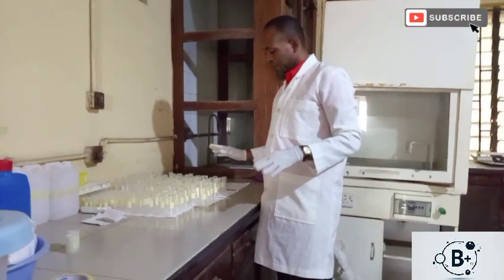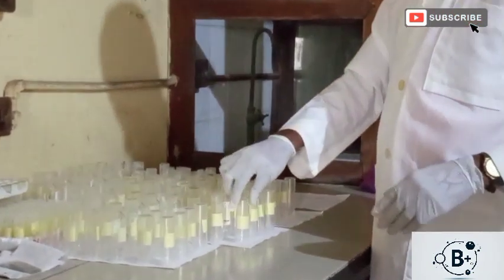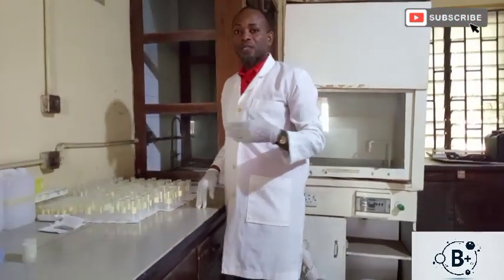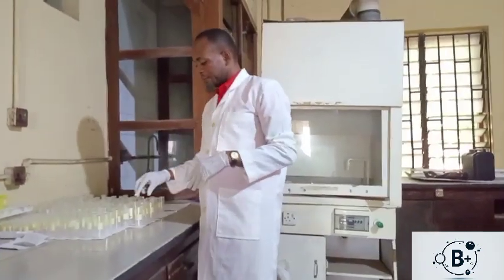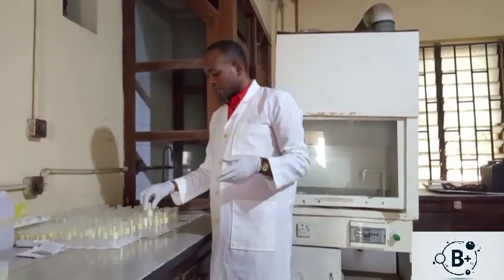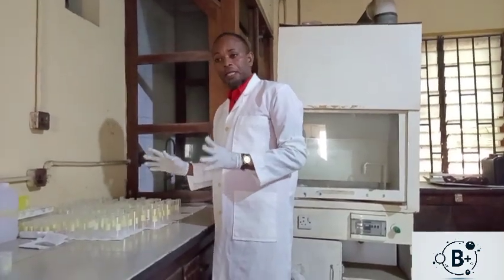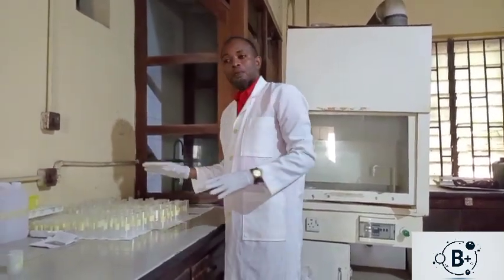So you have to assemble them, have them washed and kept clean so that they will be adequately labeled, because the animals you are using have been grouped initially into different groups, say group 1 to 6 or group 1 to 7, group 1 to 5, depending on it, and the control. So all the vessels, the capillary bottles, the capillary tubes and all that you are using must also have labels on them to show the exact group. So you'll be able to group them according to their several groups.